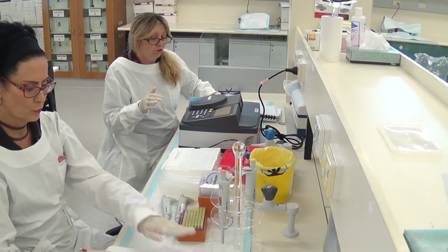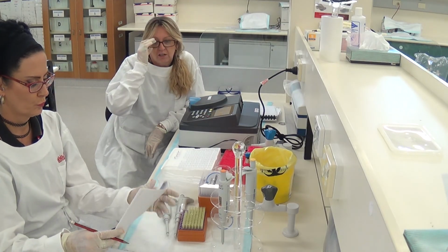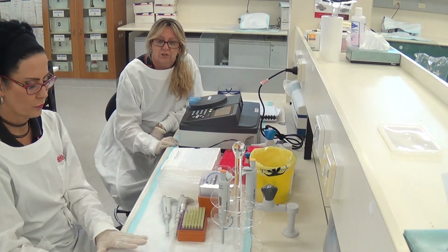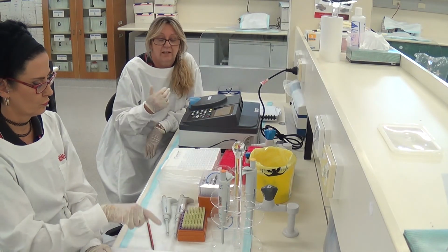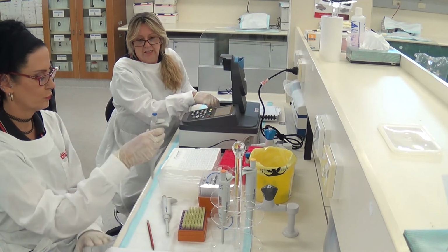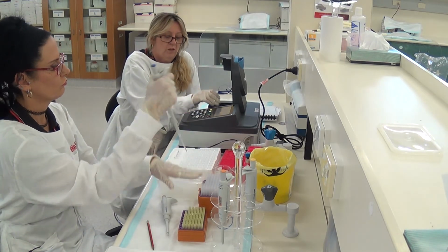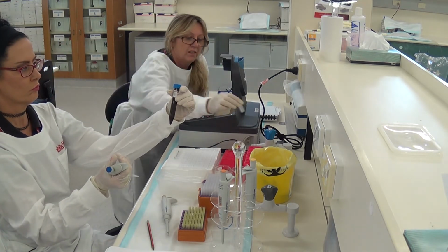So now we're going to turn to the next concentration of the ethanol, and we're going to test 0.5 molar concentration, all right? And we're going to do exactly the same thing as we did the first time. So Kat, if you want to put 900 microlitres of NAD plus into tube 2, and I'll throw this into our non-sharps waste.